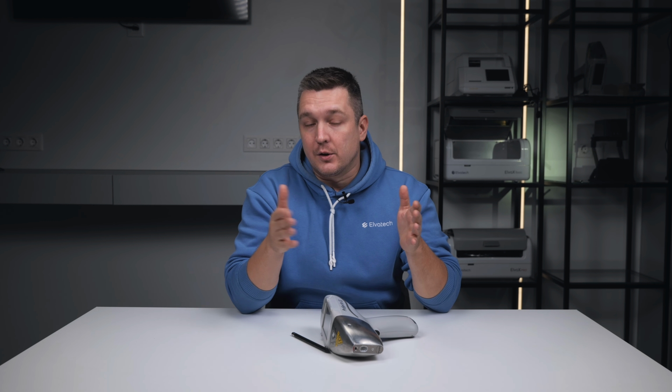So you immediately see not only what's inside, but also whether each element is within specifications. So now let's talk about where compare to alloy is especially important. Compare to alloy is particularly useful for quality control of finished products, when every batch must meet a defined standard, and QC departments where the exact compliance with requirements matters, not just the alloy name. And also material certification, when you have to officially confirm that the chemical composition meets the norms.